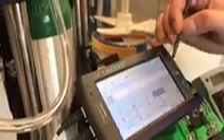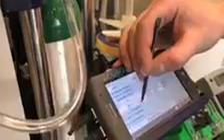We can set the parameters inside of here. We can go line 1 enable if dissolved oxygen is less or equal to 1.3 milligrams per liter. We'll set this at 1.2. And then line 2 would be enabled. We can set activate line 2 if the pH is less or equal to 6.8. So we will turn on line 2, which is our alkaline pump, if it falls below 6.8.